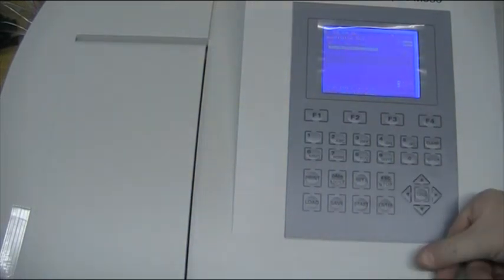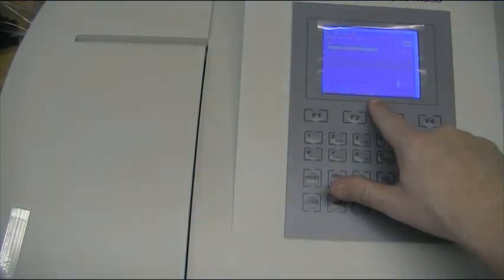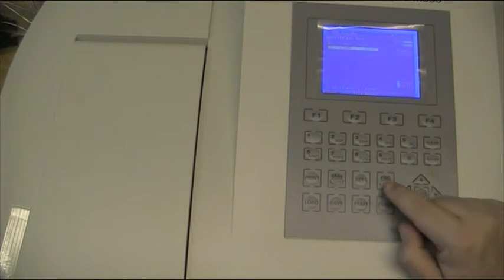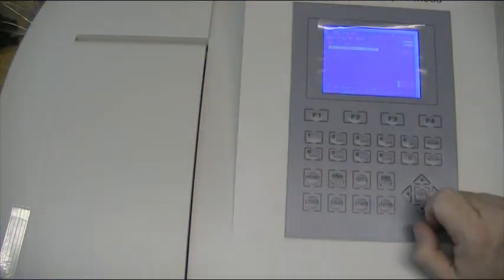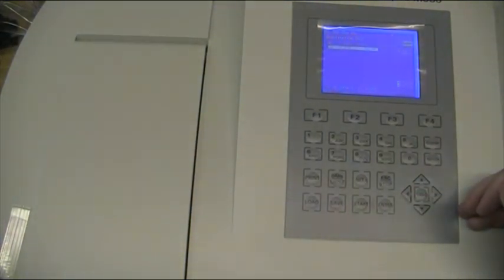When you come back to use the instrument at a later date, switch the instrument on and you can press the load key, find the file name that you've saved and press enter. That will show us the results, and then if you select the next page, it will allow us to show the calibration curve, so that you can load the calibration curve and then you can continue to use that calibration curve on another day for some new samples.